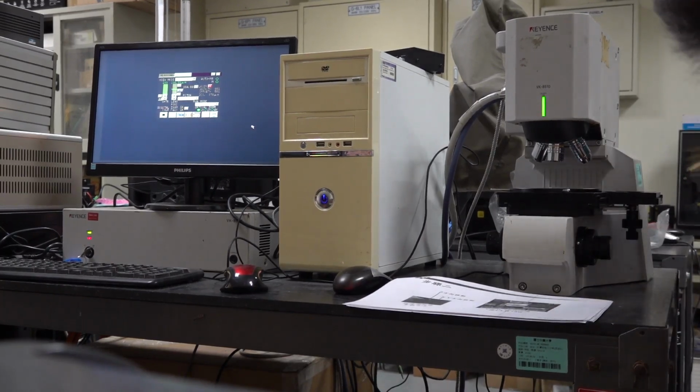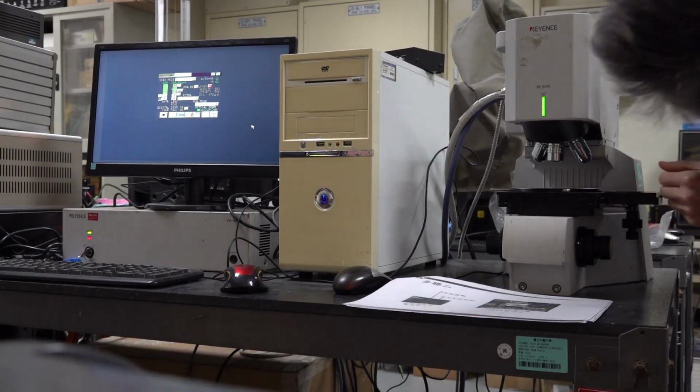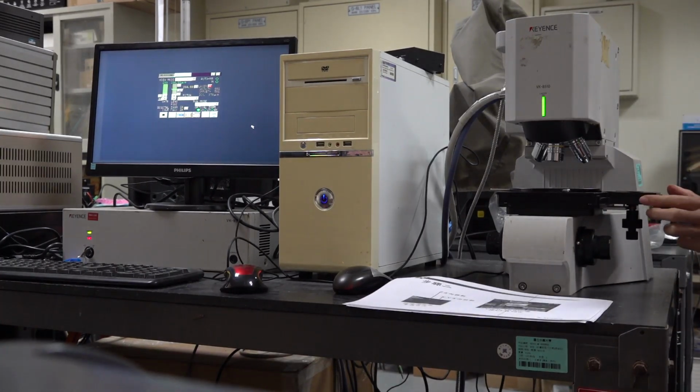Okay, let's use the 10. Yeah, this is this 10. Okay.